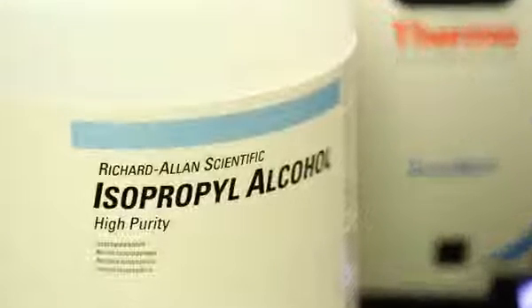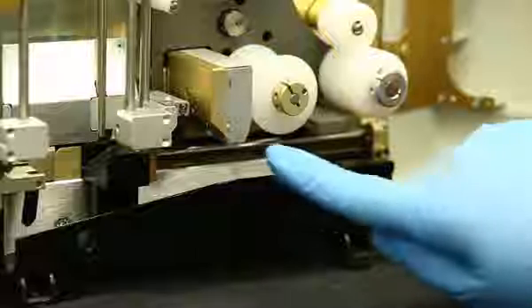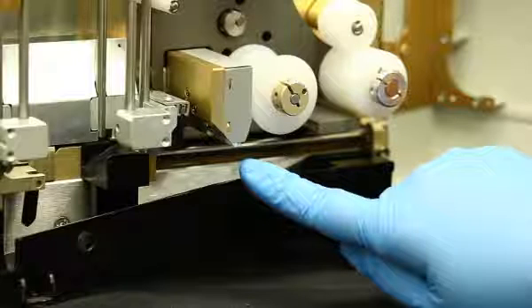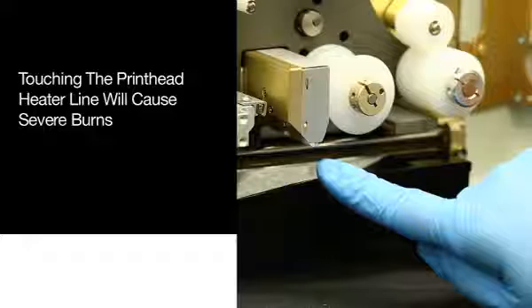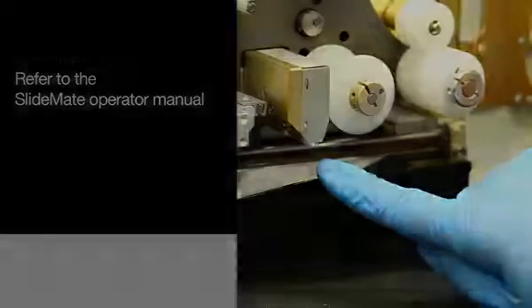Residue on the heater line should be removed with ethanol or isopropyl alcohol to avoid corrosion. Do not touch the heater line surface with a bare hand to avoid corrosion. Touching the printhead heater line while the printer is printing will cause severe burns. For a complete list of precautions, refer to the SlideMate Operator Manual.